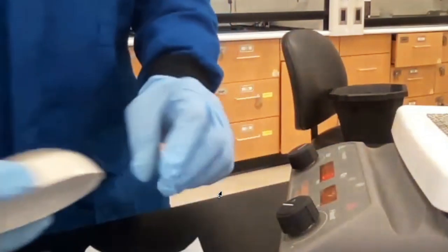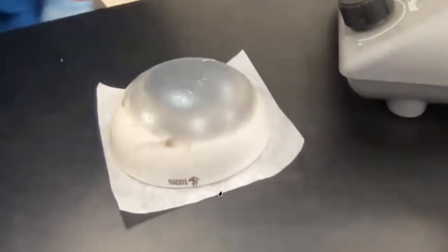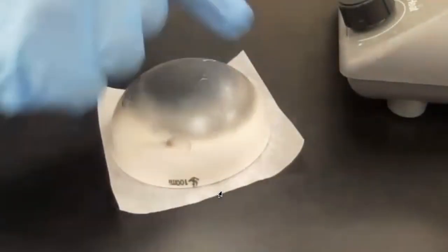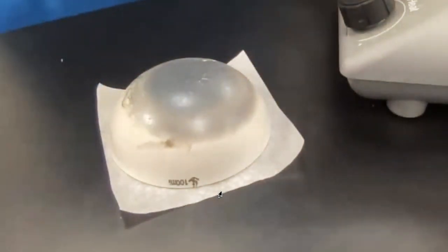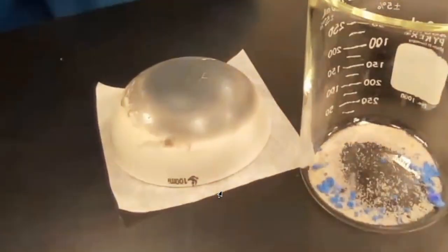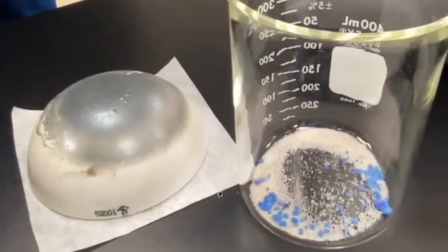Put like a napkin so it doesn't mess up your stove. And you can see right there that it's sort of metallic like. Okay. And then this one right here is the remaining 2 chemicals. And you can see again the coloration. Now it's like powder blue. You can still see the other material here that is like a beige.